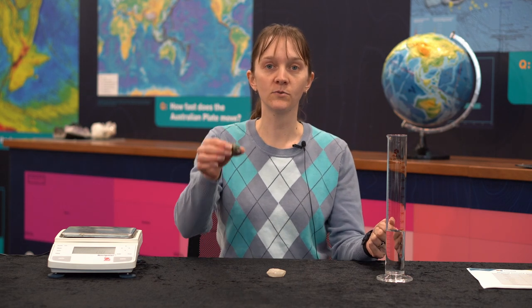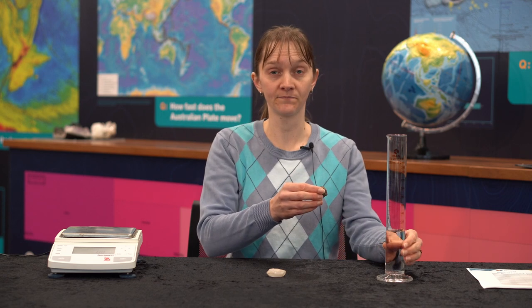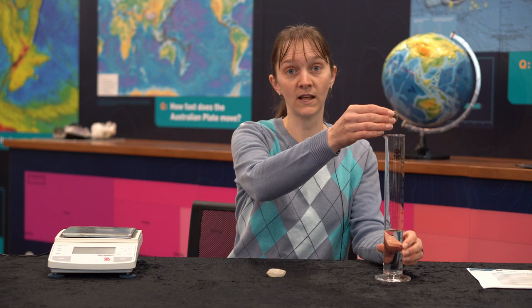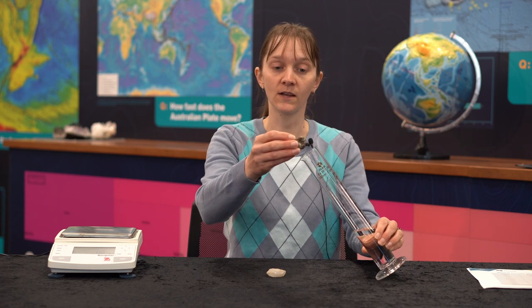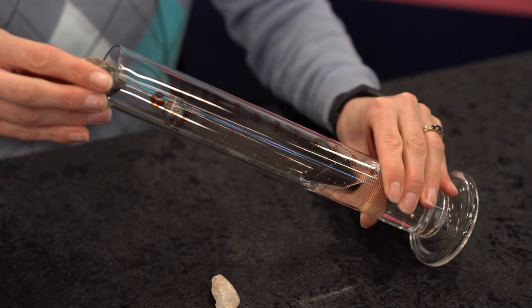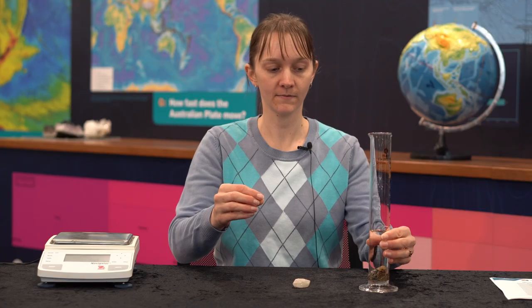We're then going to put our sample into the graduated cylinder. If you just dropped it in, water would splash out and your results would be inaccurate. So we're going to put the cylinder on its side, then we need to read the new water level.